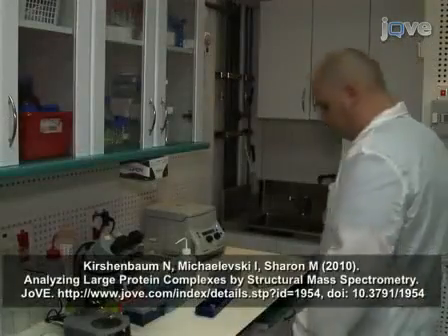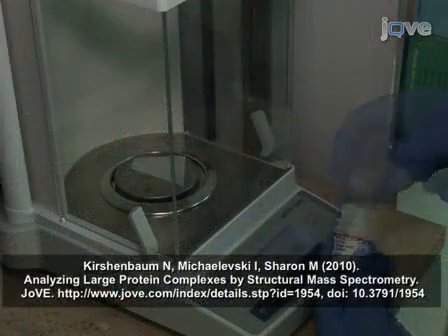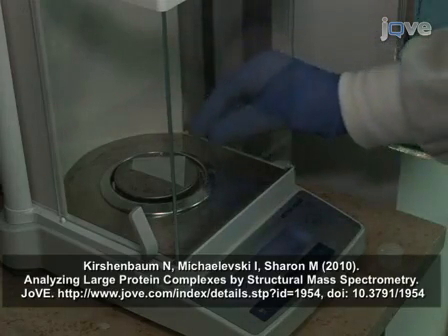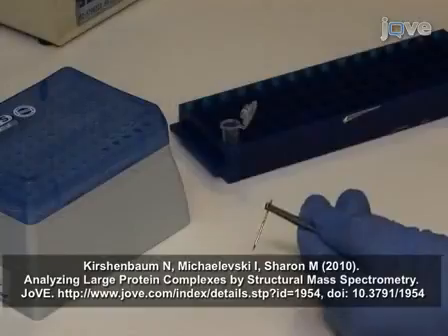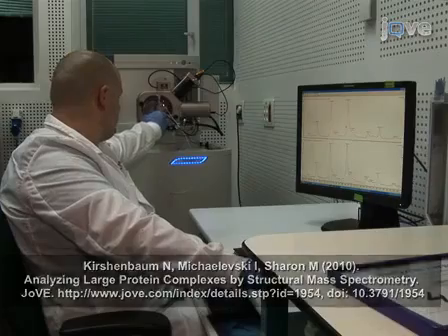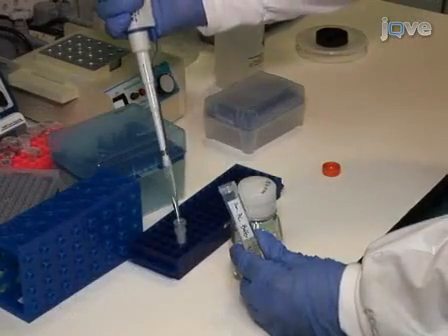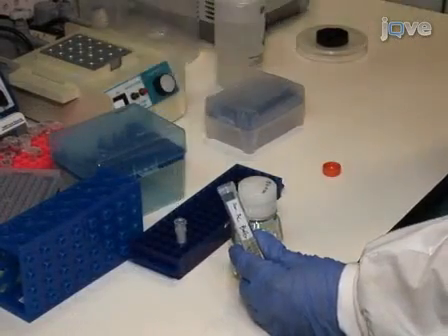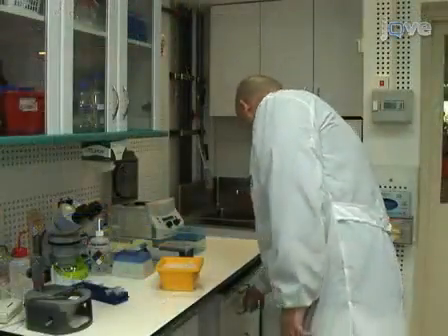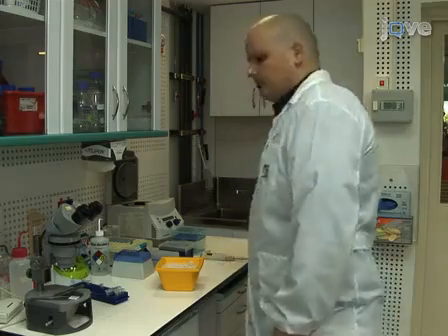This procedure focuses on ion mobility mass spectrometry, or IM-MS, analysis of protein complexes. The sample preparation steps, instrument calibration, and MS and tandem MS optimization procedures are demonstrated in a related JoVE protocol. In general, this protocol involves low micromolar concentrations of complex in a volatile buffer such as ammonium acetate. Given that one to two microlitres are consumed per nanoflow capillary, prepare 10 to 20 microlitres as a minimum volume to enable optimization of MS conditions.